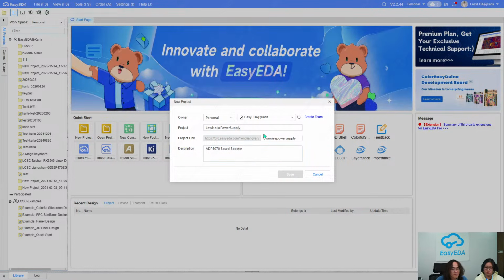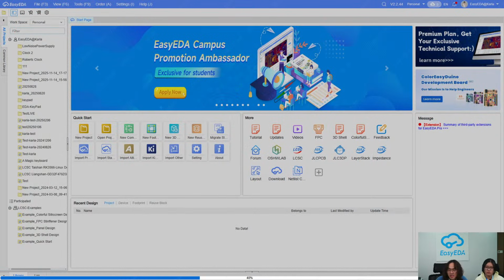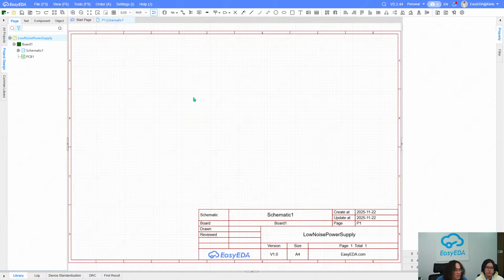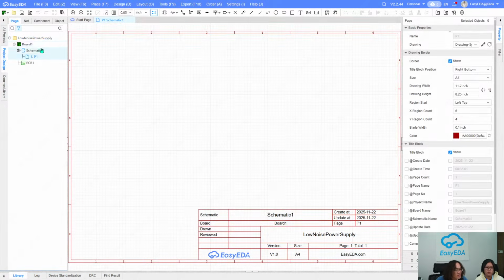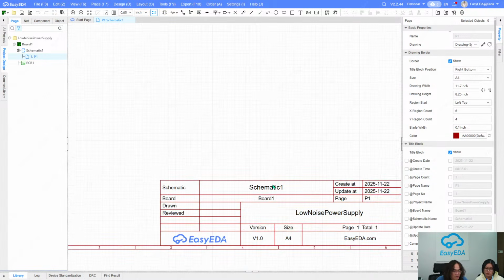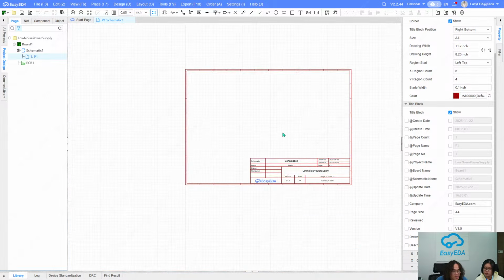And click Save. So wait a second for the project creation. Once you finish your project creation, we can see it's created a board here, and we can double click to its schematic. You can change the profiles here, like the company and so on, and in this case I'm not going to change it.